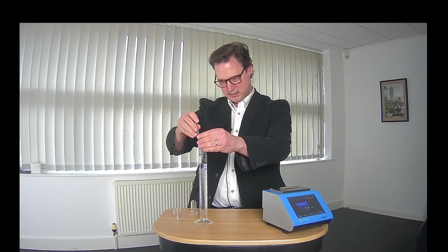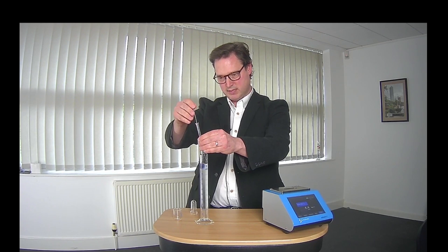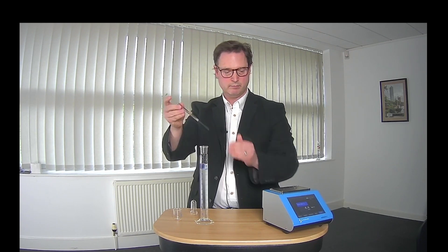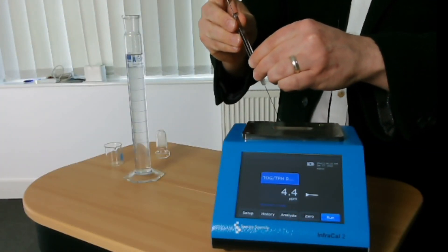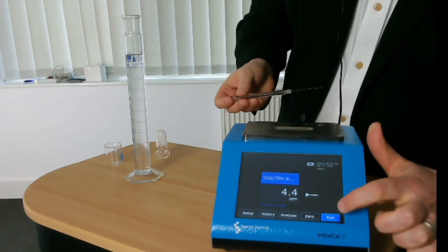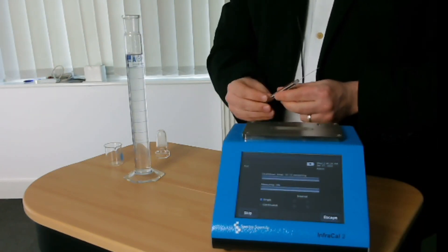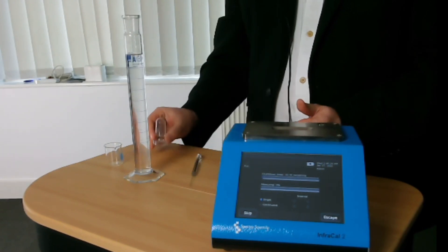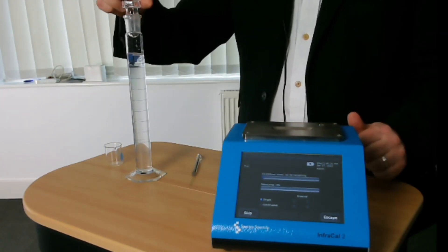I take 60 microlitres of that sample into my syringe, and present it onto the InfraCal analyser. All of the hexane will evaporate from the top of the stage, leaving only the fat, oil and grease behind.